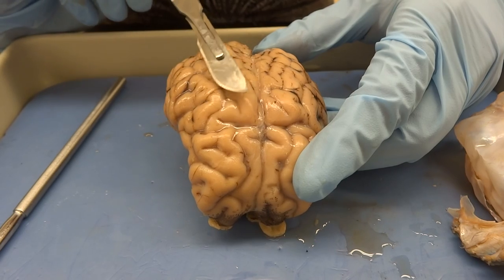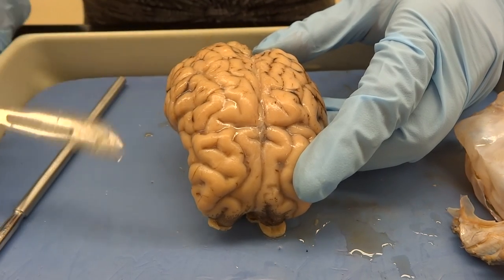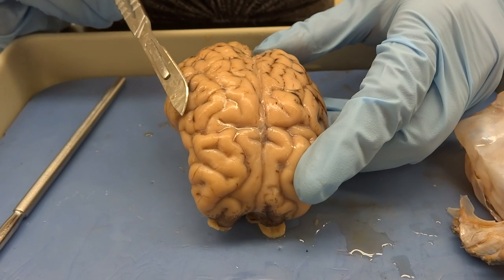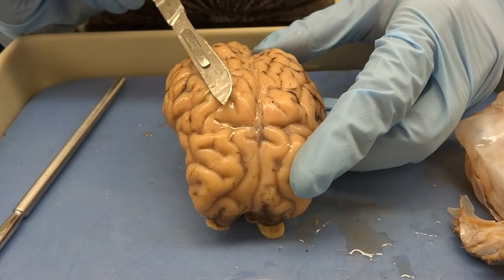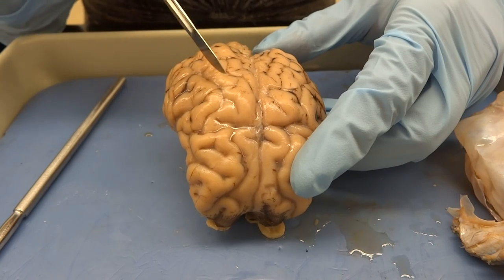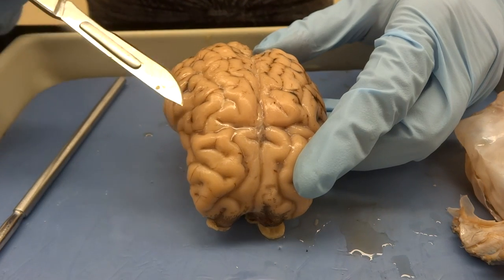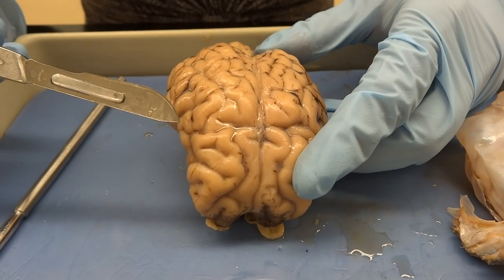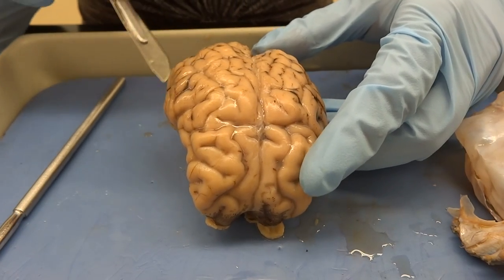As you saw earlier, I had already kind of taken apart the dura from this side. Really all I did is I very gently used the side of my scalpel and just sliced along that way. I didn't want to hack — I just wanted to very gently slice, because it cuts very easily. It's very paper thin. So I cut all along the top here.